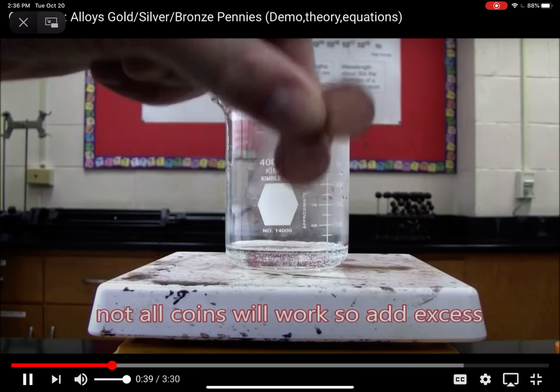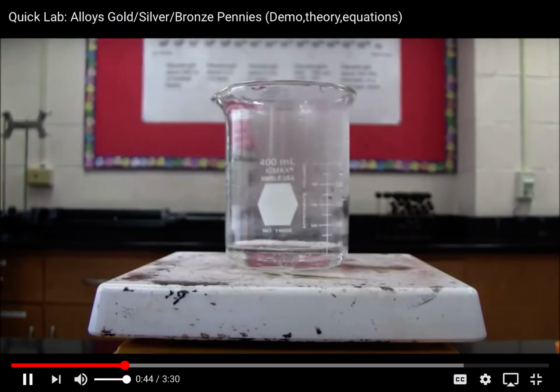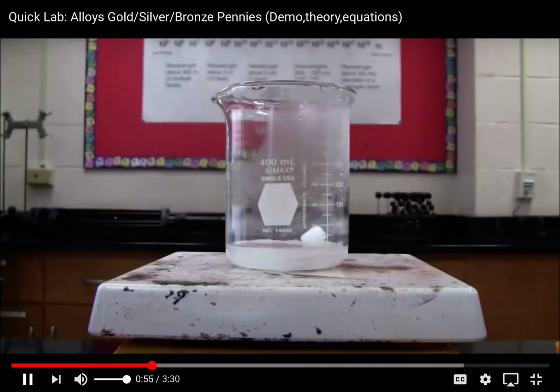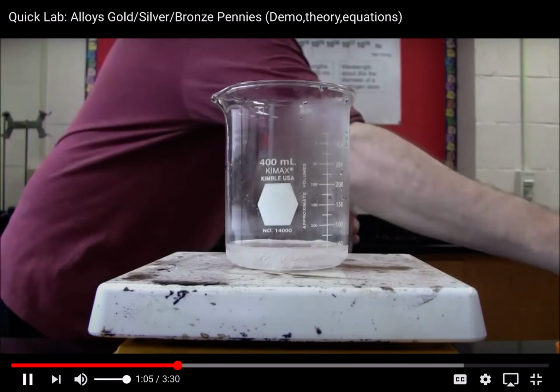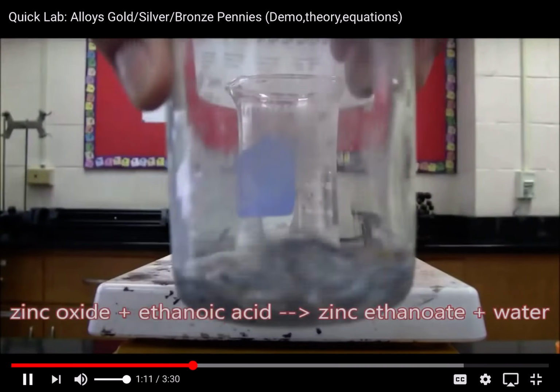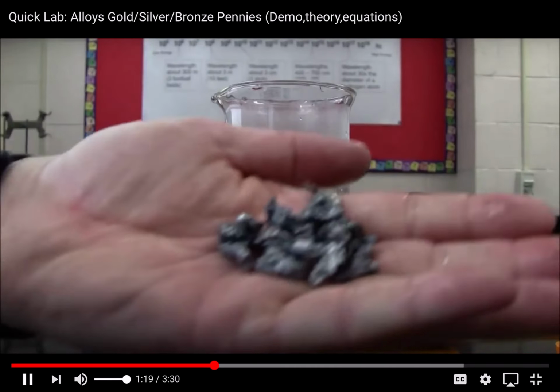Got my pennies to put in. Can you see it? Perfect.